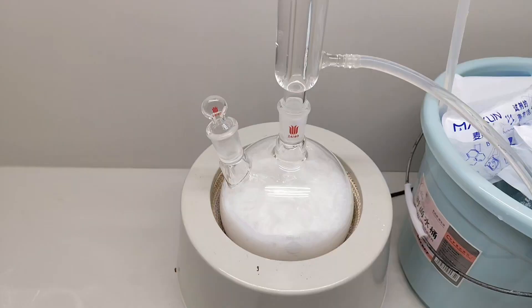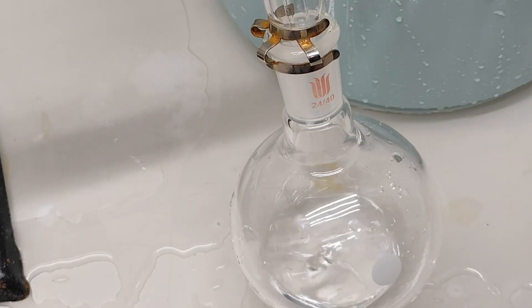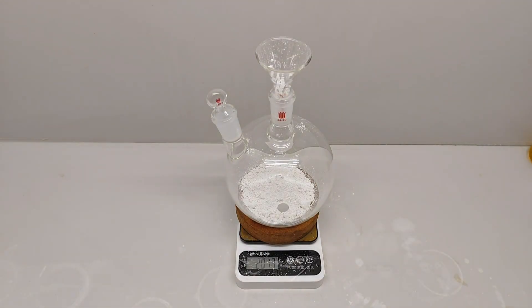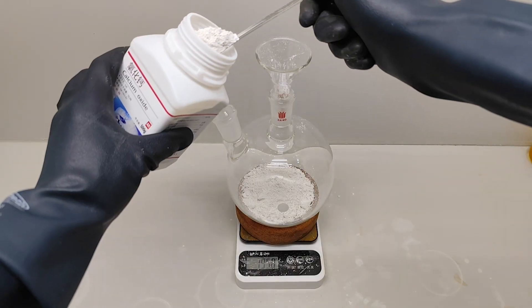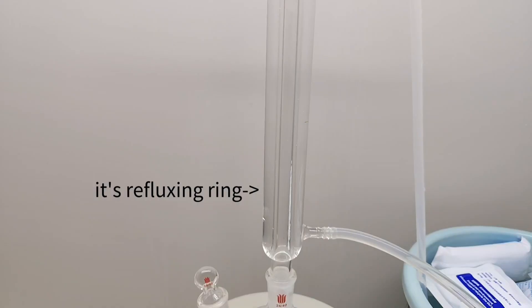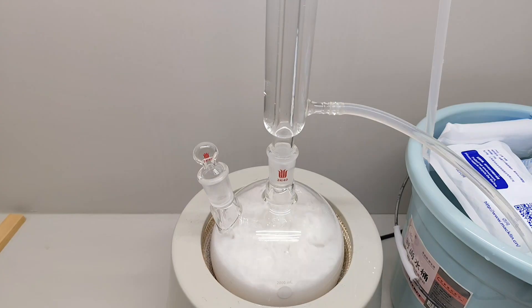I usually make anhydrous ethanol by refluxing a mixture of calcium oxide and 95% ethanol, then distilling it to obtain anhydrous ethanol. According to calculation, the weight ratio of 95% ethanol to calcium oxide is about 5 to 1. For 75% ethanol, the ratio changes to 5 to 6, so it would be better to do a fractional distillation before reacting the ethanol with calcium oxide.